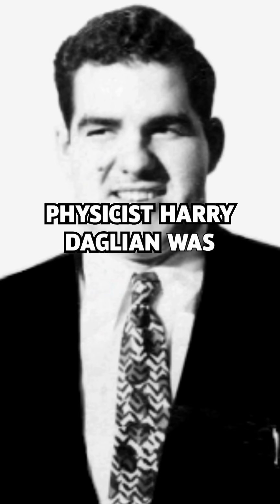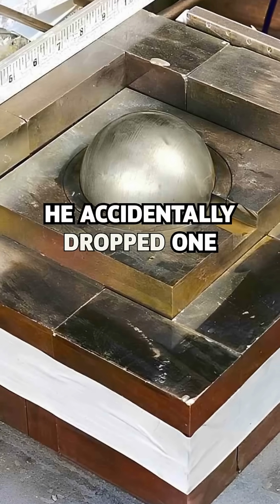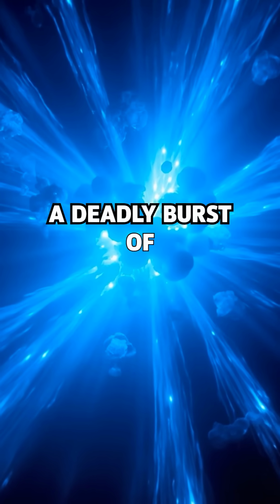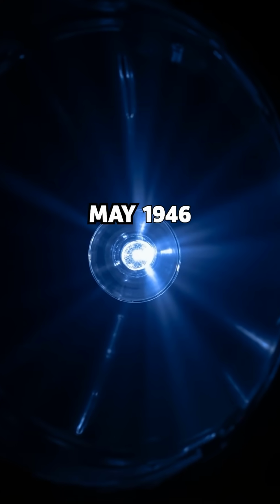August 1945. Physicist Harry Daghlian was testing how close neutron-reflecting bricks could get before the core reached critical mass. He accidentally dropped one directly on the core. A flash of blue light, a deadly burst of radiation. Daghlian died 25 days later from acute radiation poisoning.